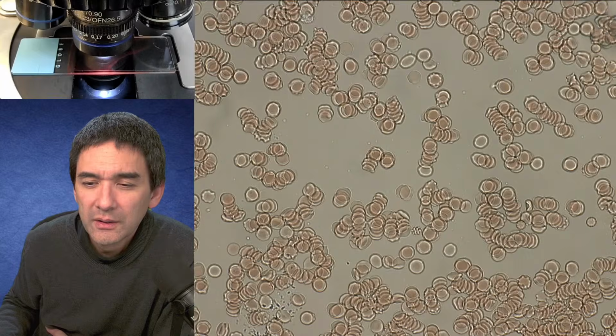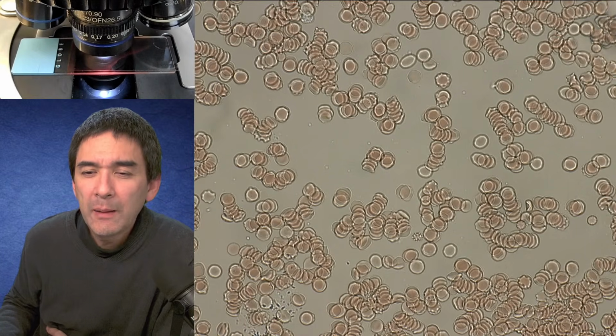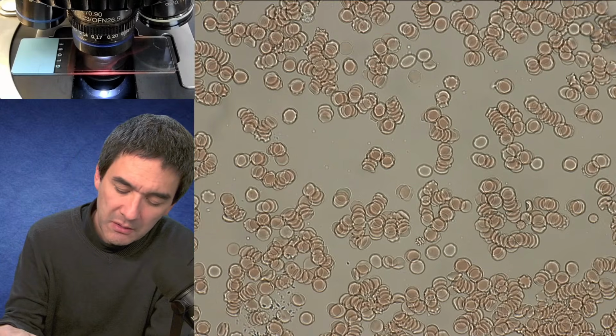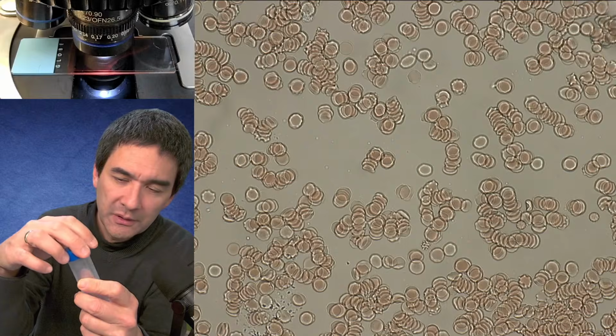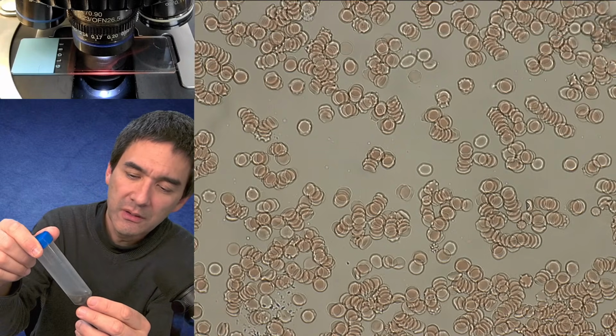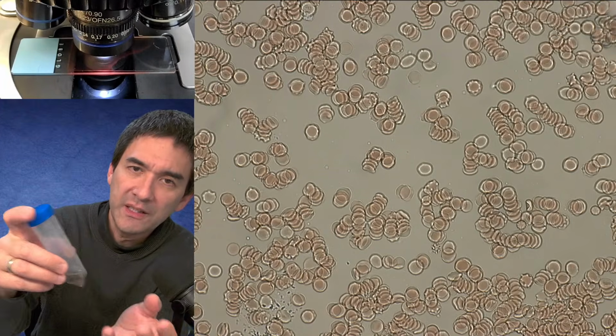Okay. And do we leave the cap on after putting in the hydrogen peroxide? I would do that. There is, of course, gas forming, oxygen gas, so every now and then I open it up to let the pressure out. But I leave it on, especially if you put it in a water bath, you want to prevent evaporation.